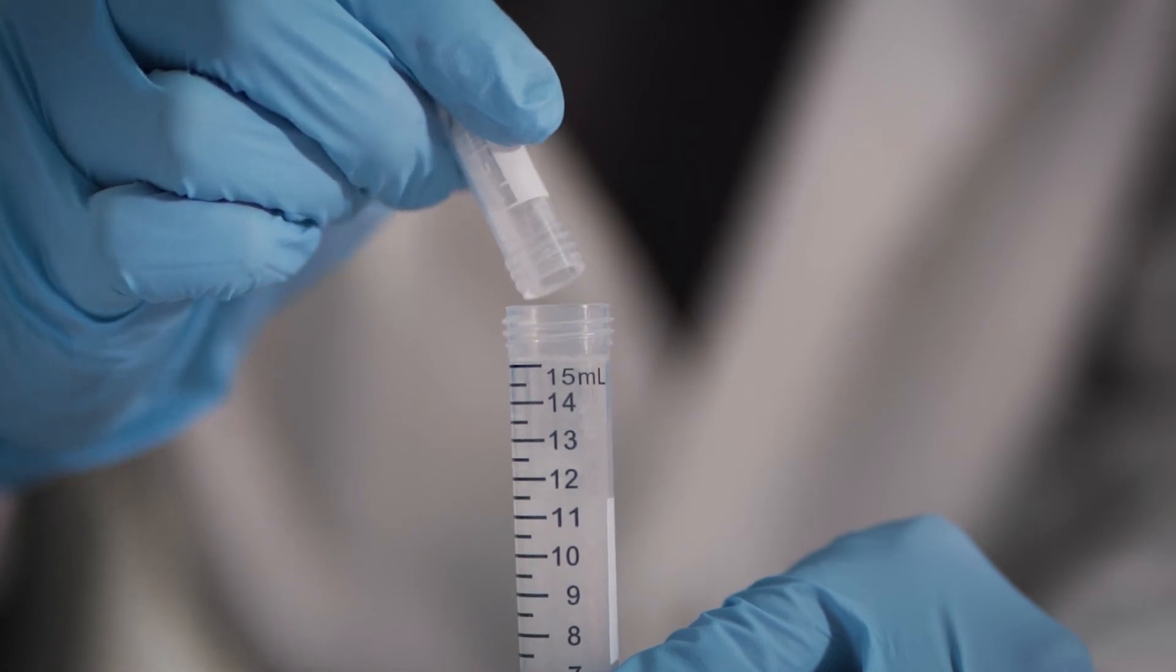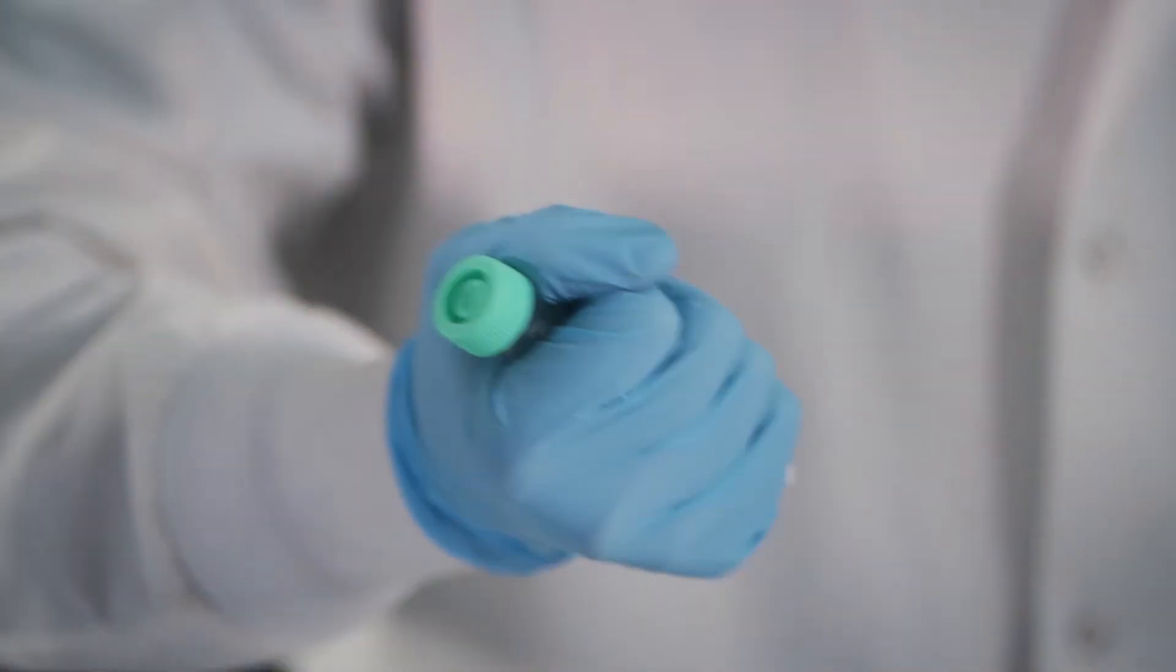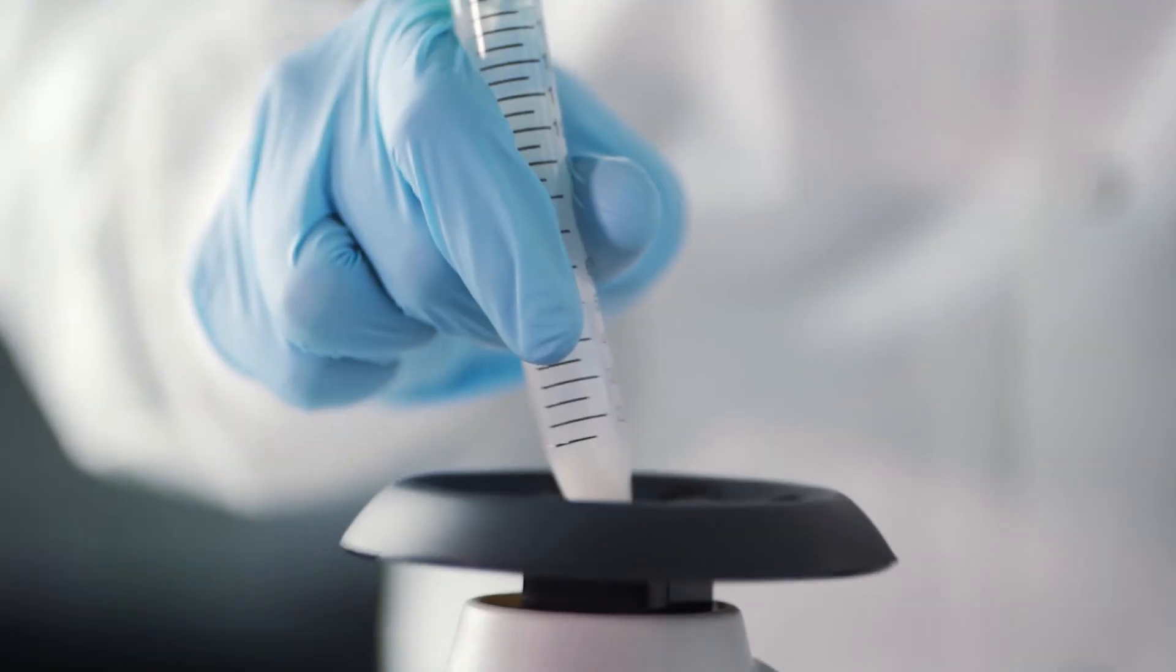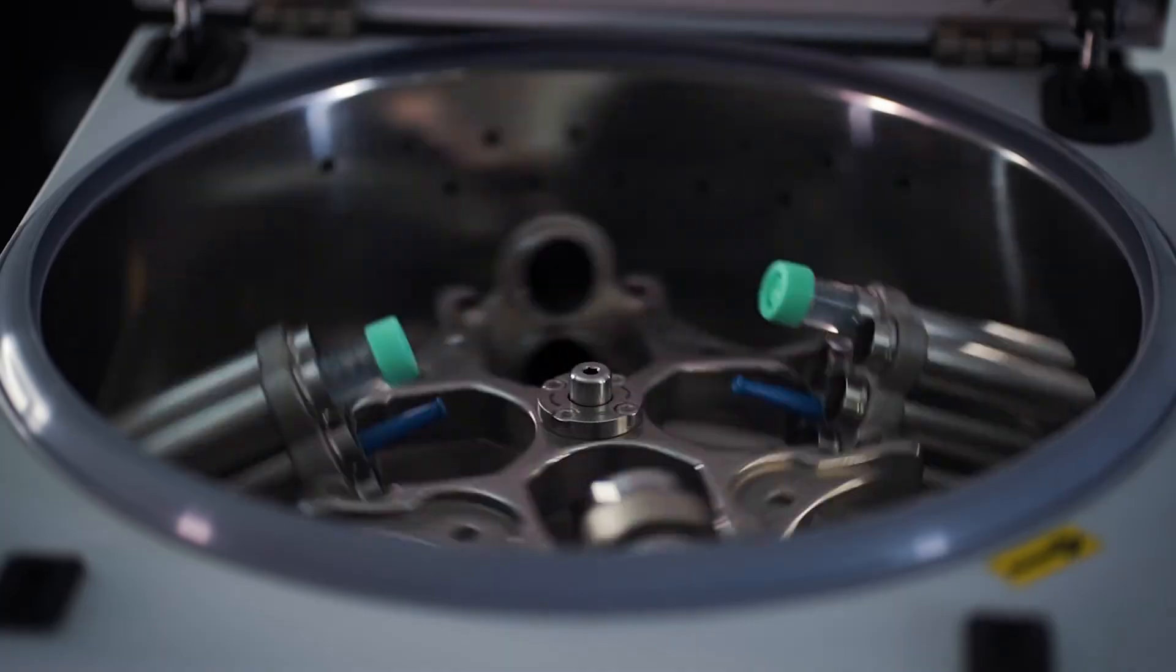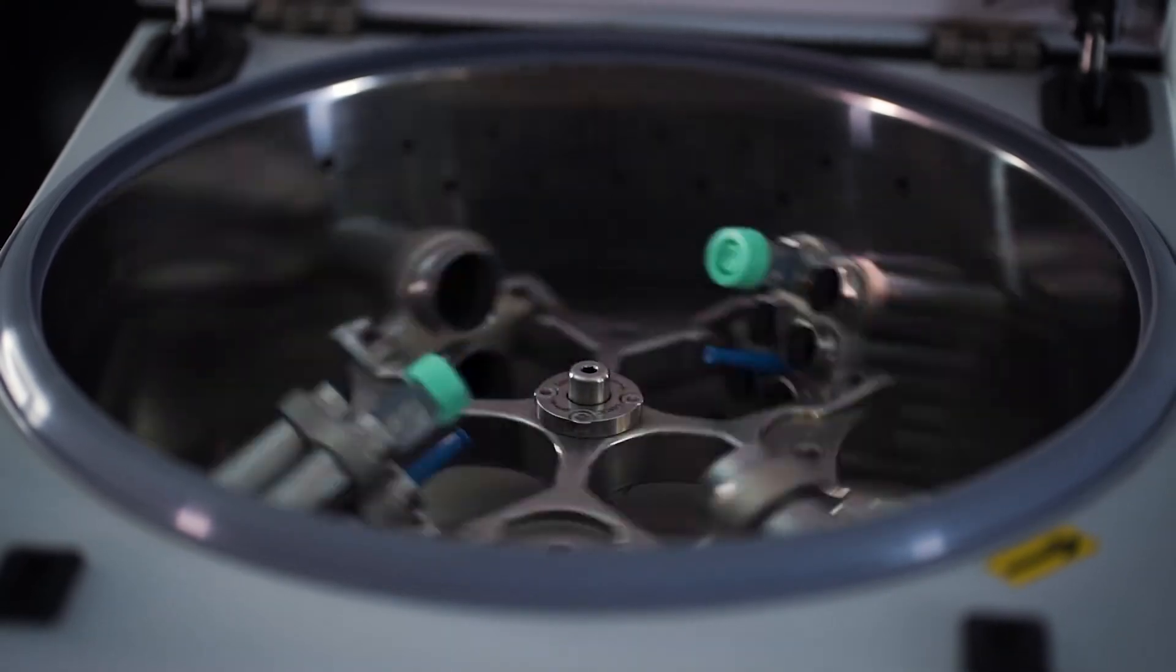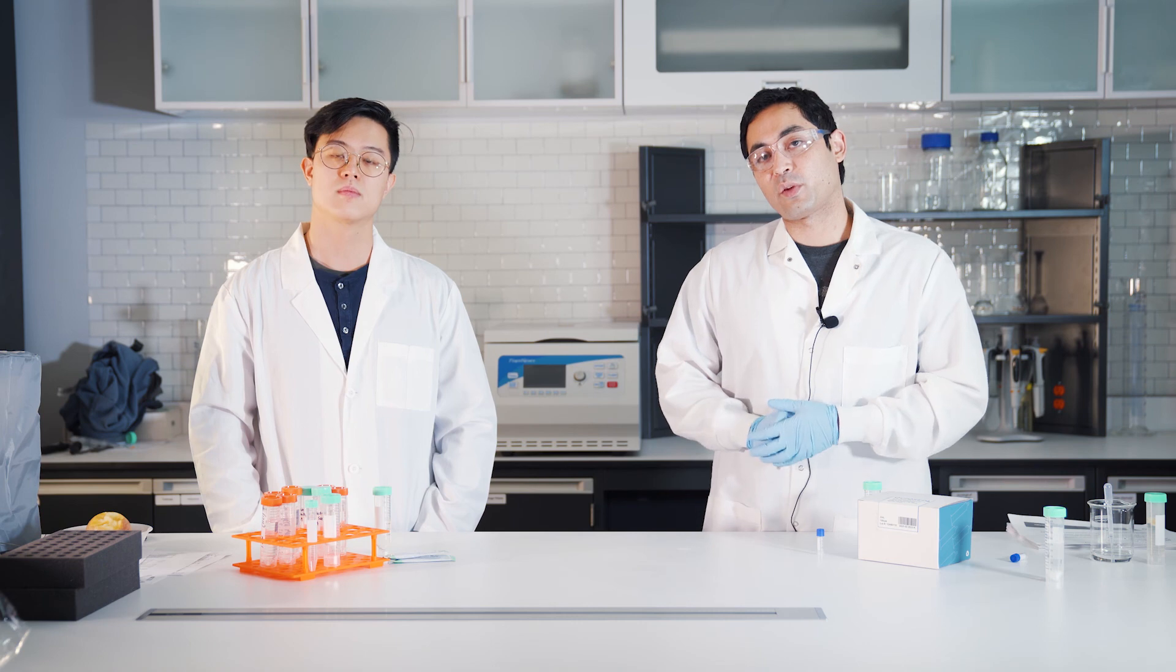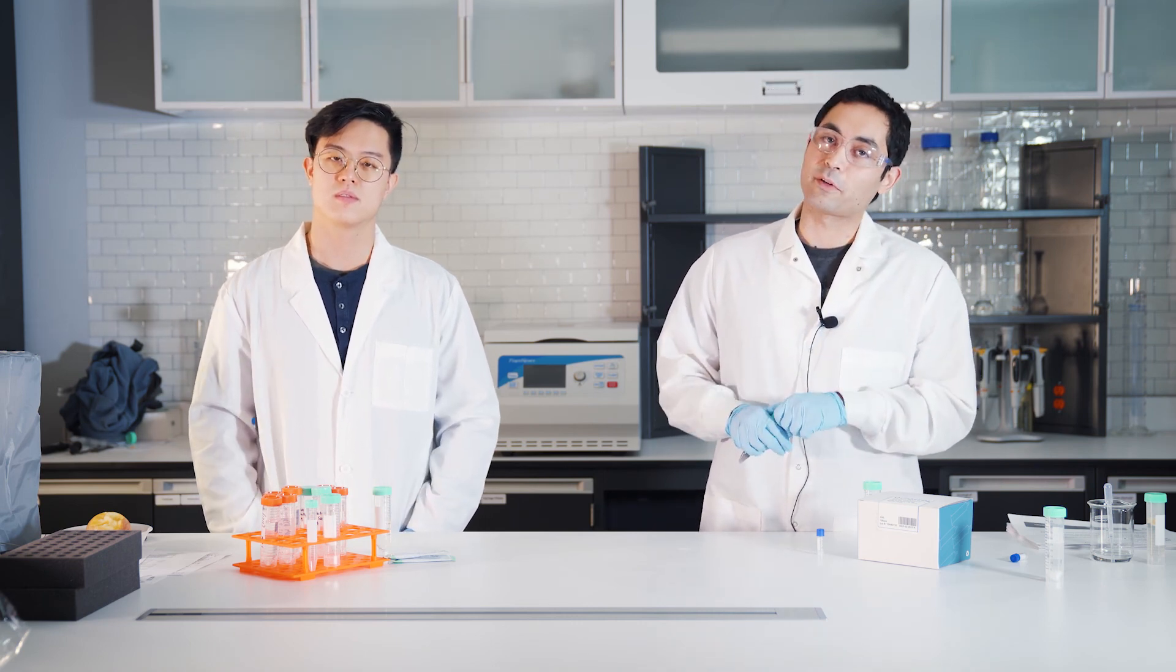We'll get those guys in, we're gonna shake. Professional. I'm gonna put this in the vortexer. And then after we vortex you centrifuge again, you spin down, you take the supernatant, you can filter it in a syringe filter if you want, and then it's ready to go into the LCMS for pesticide analysis.